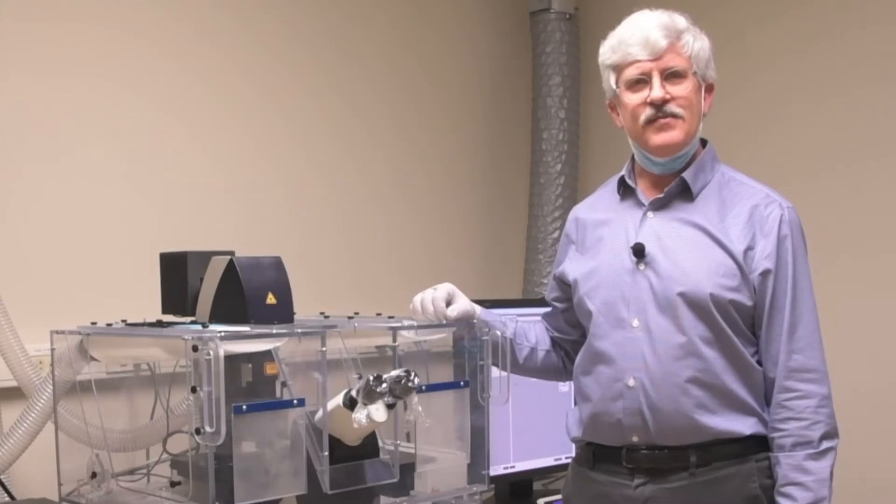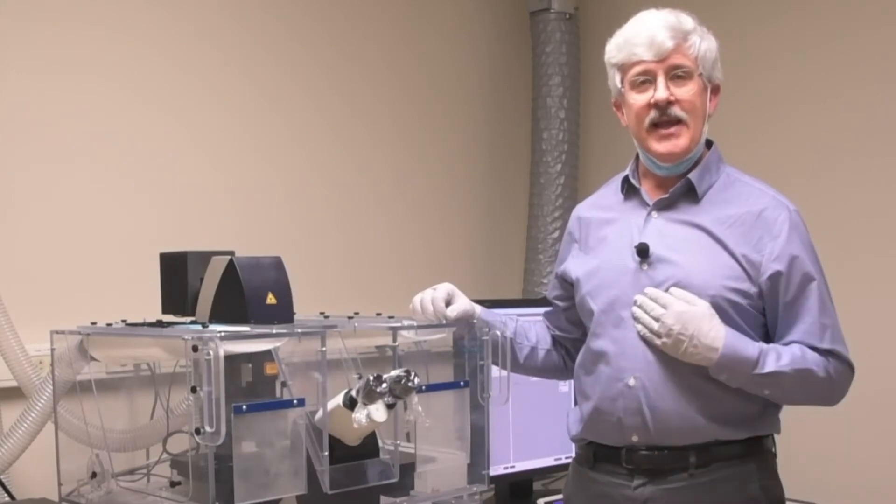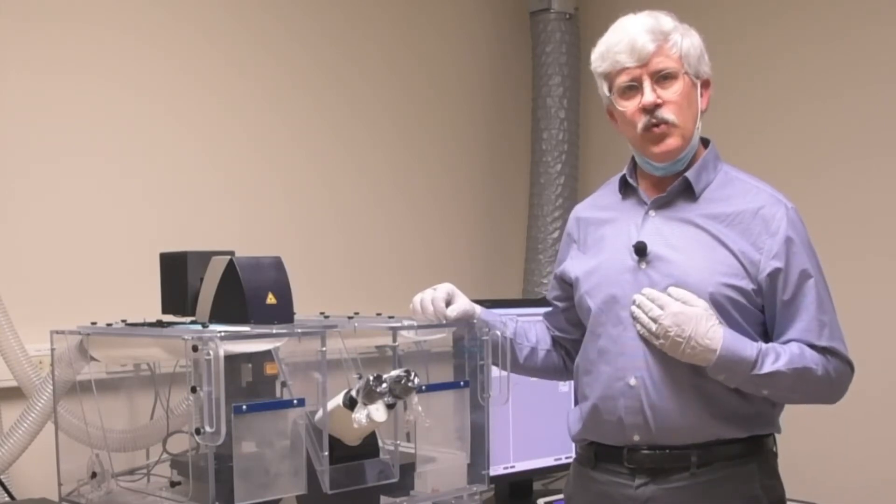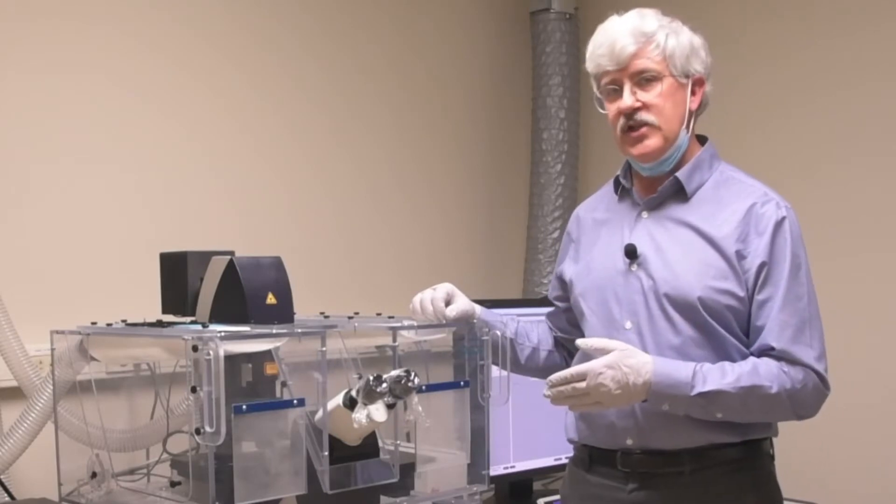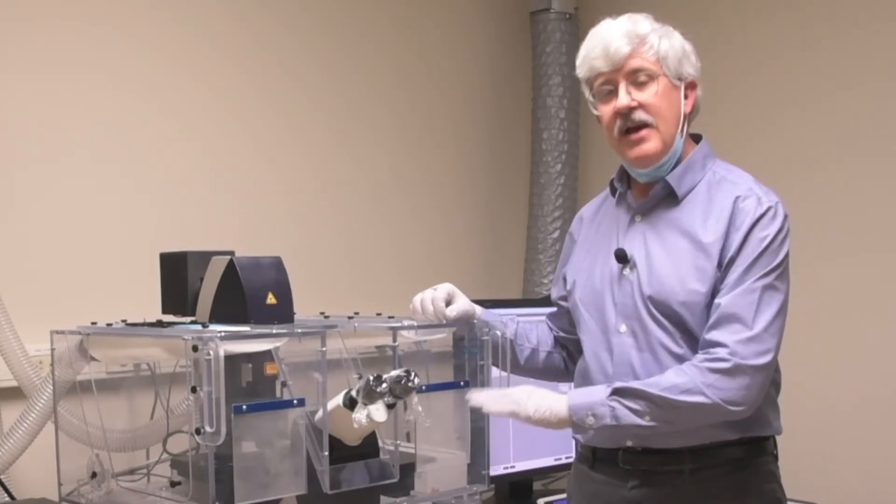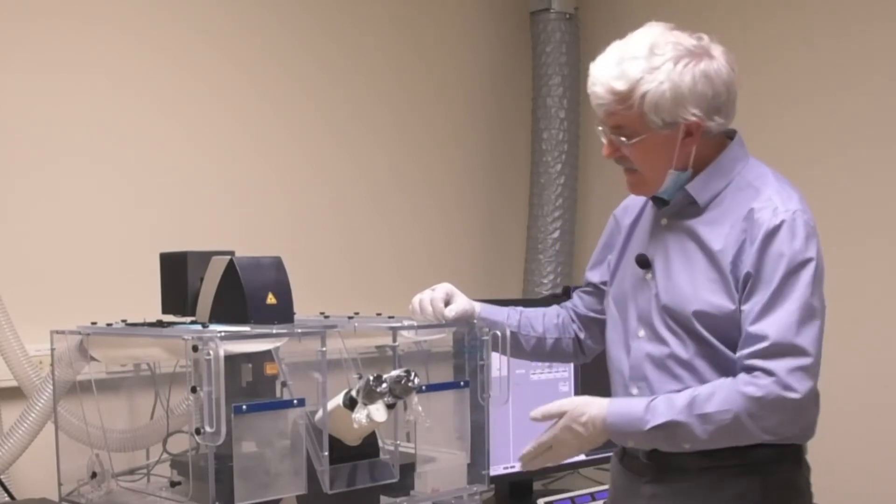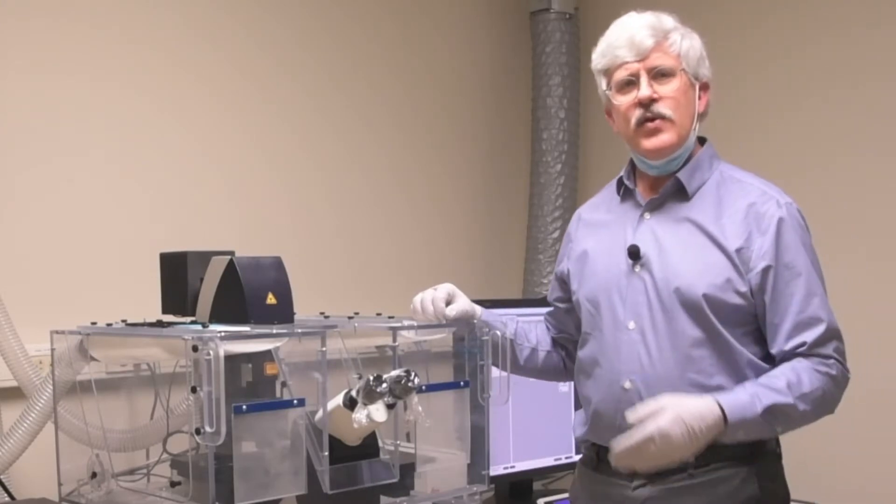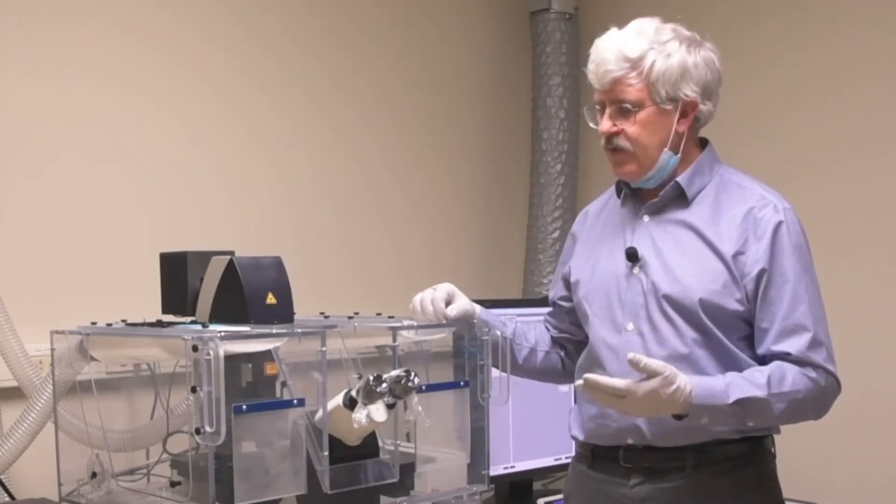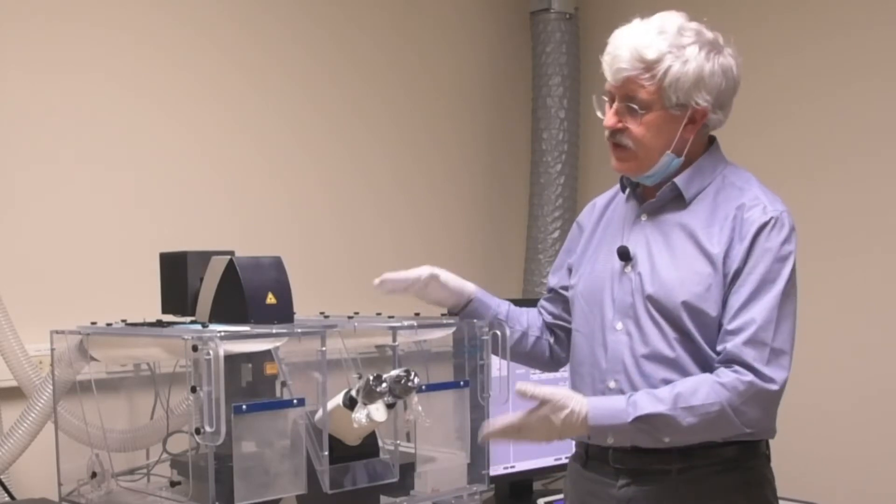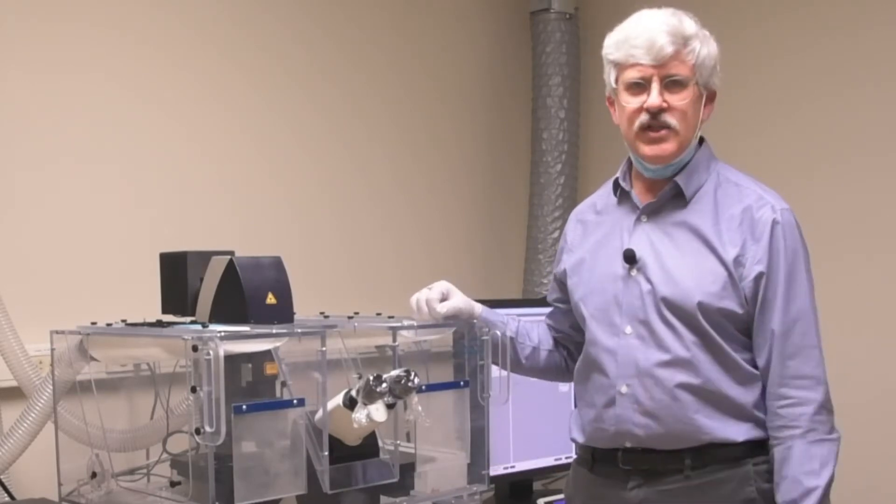Welcome back to the SP5 Confocal Microscopy Series. My name is Jamie Hayden, and in this video we'll be taking a look at the initial preparations for placing your slide on the stage, finding an area of interest, and sending it over to the confocal. You can't actually look at the laser light coming out of the confocal, so to begin with we have to take a look through the microscope in a more traditional way.